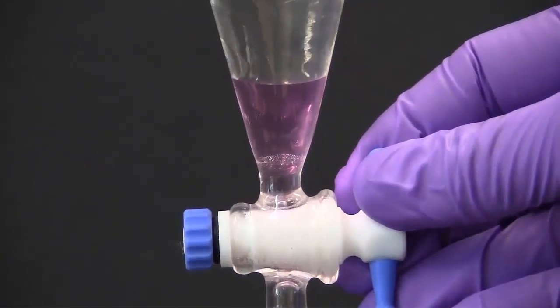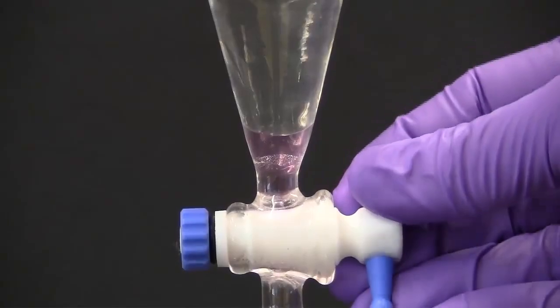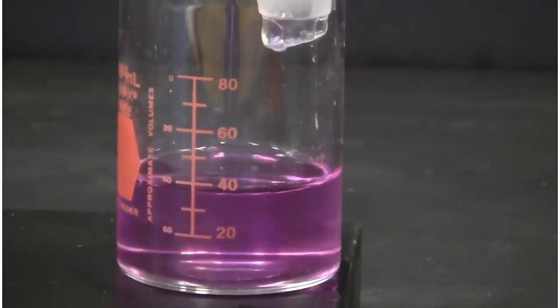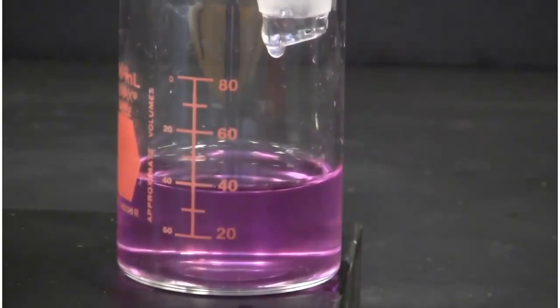Leave one or two drops of the lower solution in the funnel. This will help avoid contamination of the solution in the flask. If you are attempting to isolate the solution in the funnel, allow one drop of the upper solution to fall into the flask.